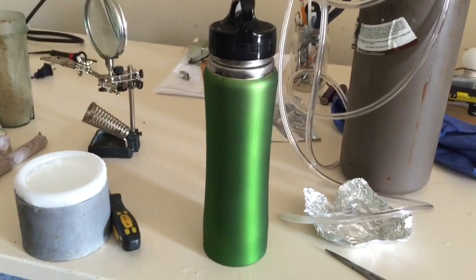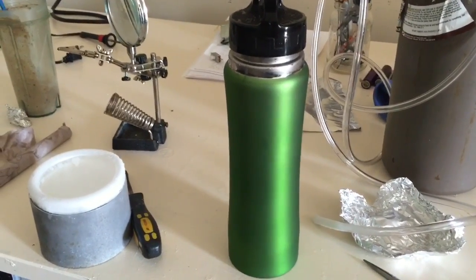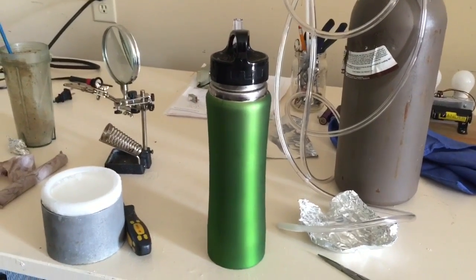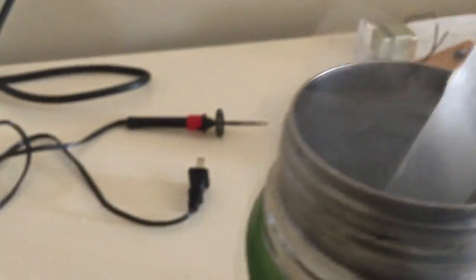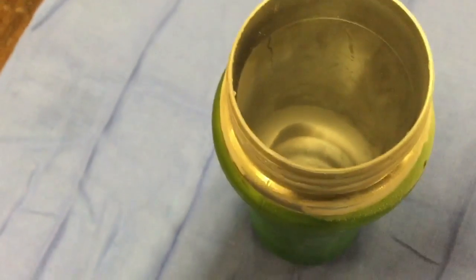This will be kind of interesting just to see how this works with this simple home setup. Check back in a few minutes. Okay - it's started to form! You can see a little slug of ice forming at the top there. Let's leave it in here some more and let the ice propagate. It's been frozen for about an hour now - let's see what it looks like.